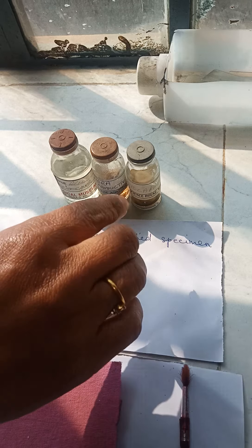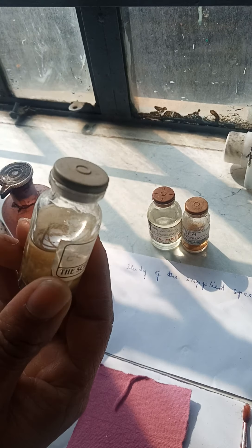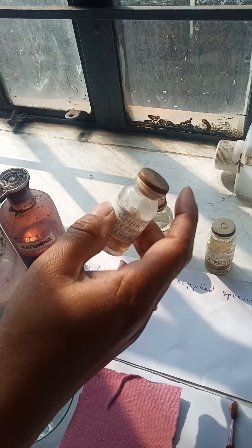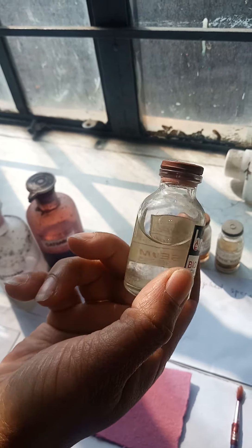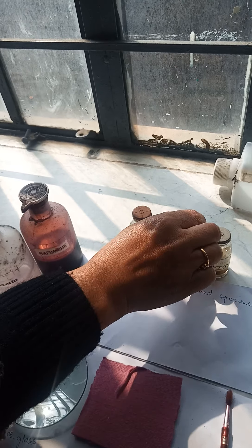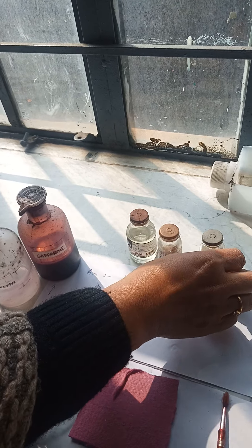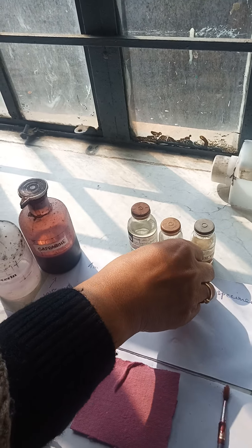Algae come in these small bottles — they are microscopic and don't come in big containers. This is one specimen of algae, this is another, and this is another. The names are visible on the bottles. This one is Ectocarpus, this one is Chara, and this one is again Ectocarpus. These are the specimens we will be working with in the practical for the algae portion.